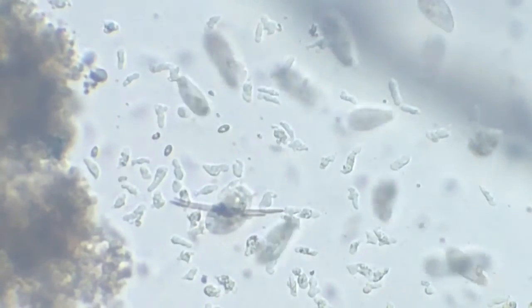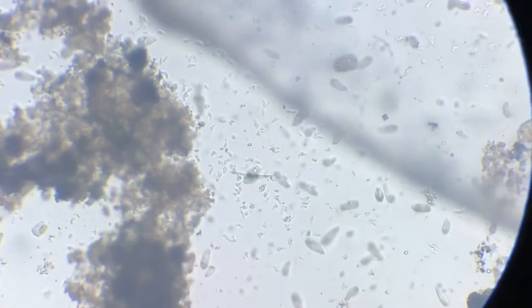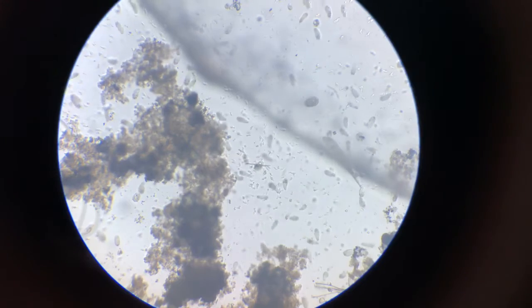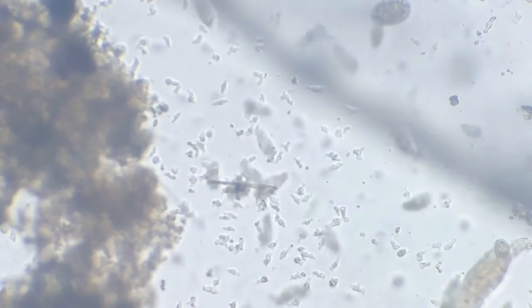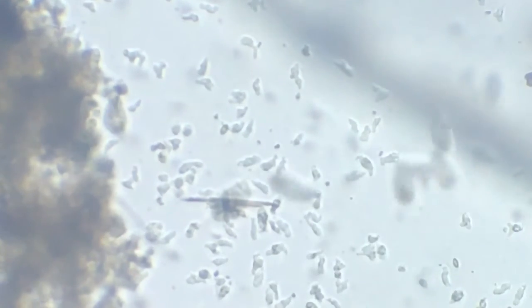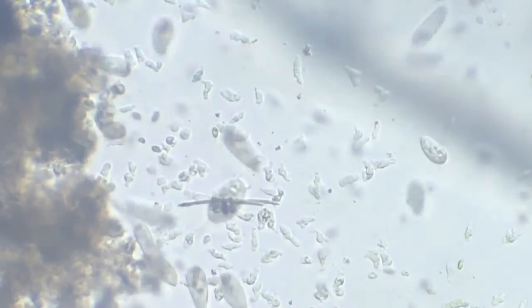My goodness, look at that. What a cluster of amoeba it is. It's a huge cluster. Okay, so this is how they appear without digital magnification, and now that I'm digitally magnifying, we see amoeba approaching. And now that we magnify it further, we will see how they are moving.